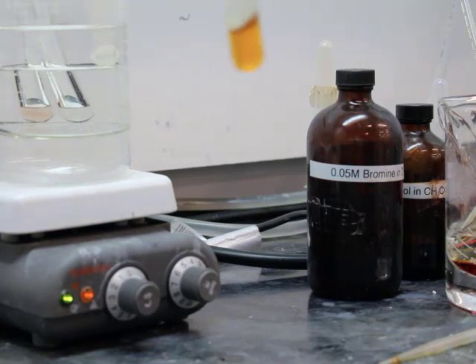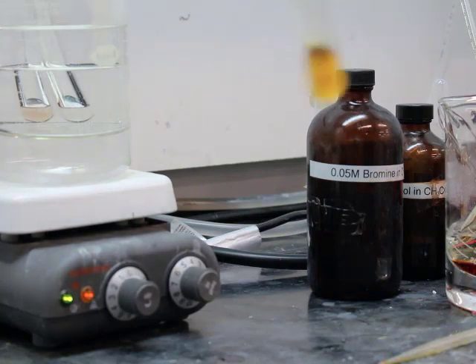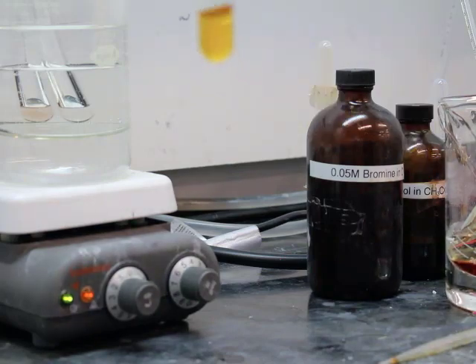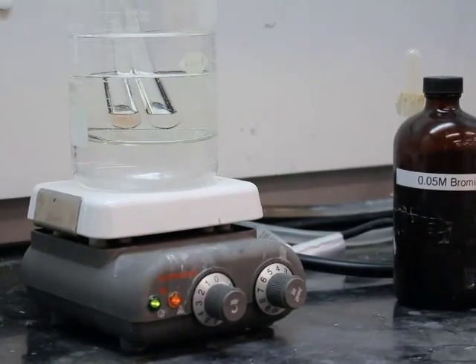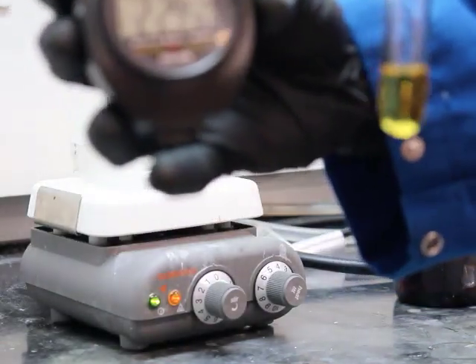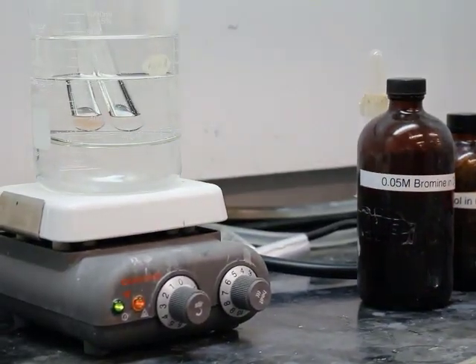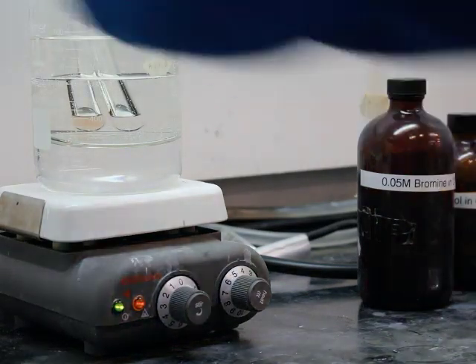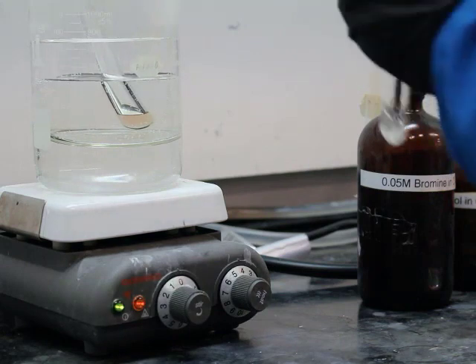Next up, after diphenyl ether, we're looking at acetanilide. We can see this light brown orangey color needs to hit up with some yellow. We need yellow. Time lapse has occurred. So we're at two minutes, 24 seconds, and we could see that yellow color in the test tube. That one was obvious that a reaction occurred.